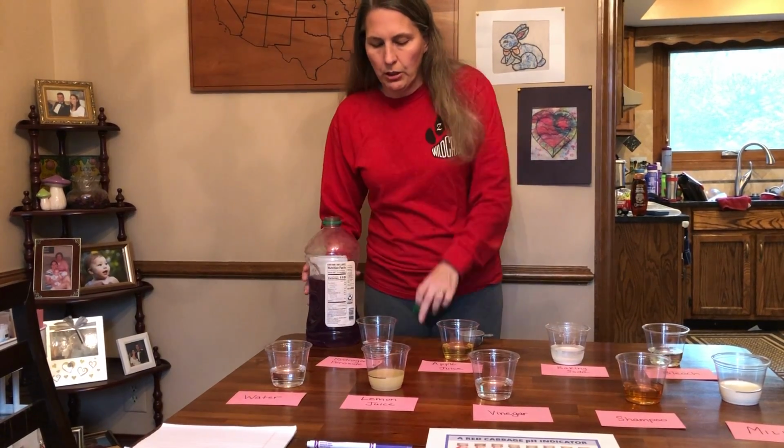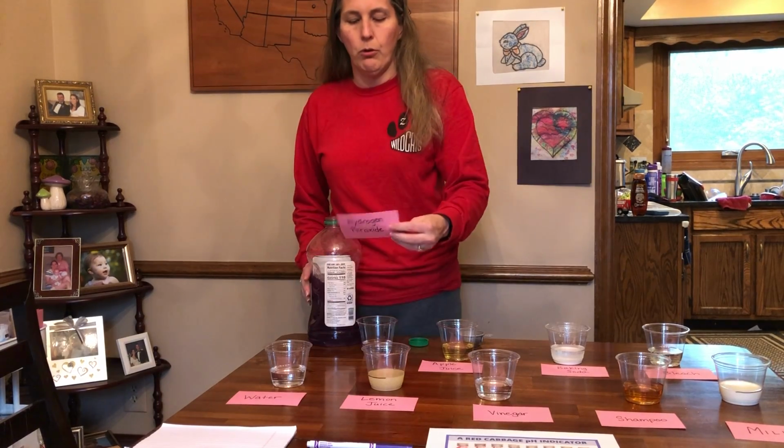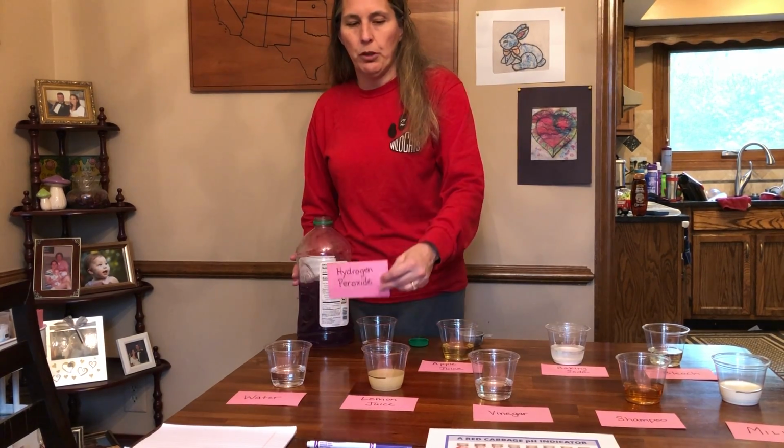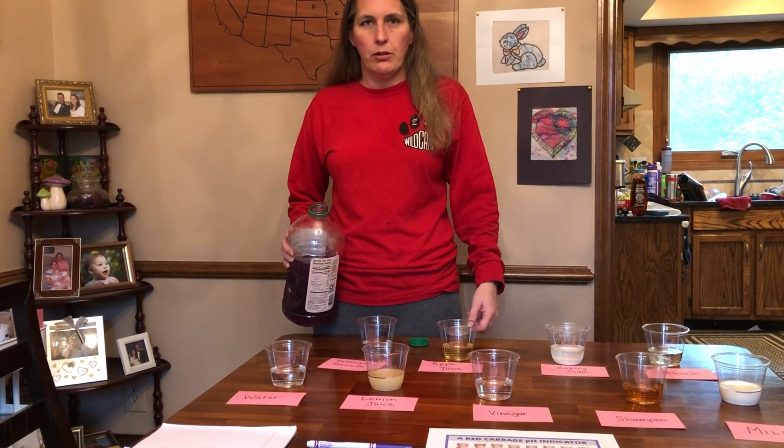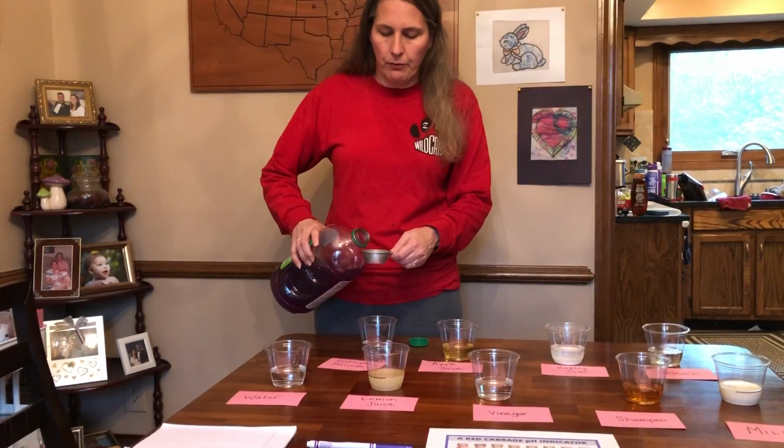We're going to start with hydrogen peroxide. So Sarah thinks base and Will thinks acid. So can you see our color change chart? Kind of, sort of? No? Sarah's helping me out with videoing today.